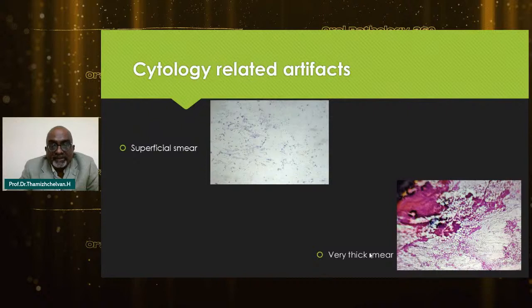Number one, let's start with cytology. Cytology is a big problem because cytologies are done basically by oral medicine specialists, surgeons and private practitioners. At times, these clinical practitioners think that the slide might cause pain and they take a very superficial smear, that is, they don't apply enough pressure on the smear. So we see improper structures on the slide and it is very difficult to give a diagnosis. A few enthusiastic clinicians really apply pressure and keep on adding and adding, and finally we get a very thick smear. The diagnosis is a very big problem. So how to avoid it?